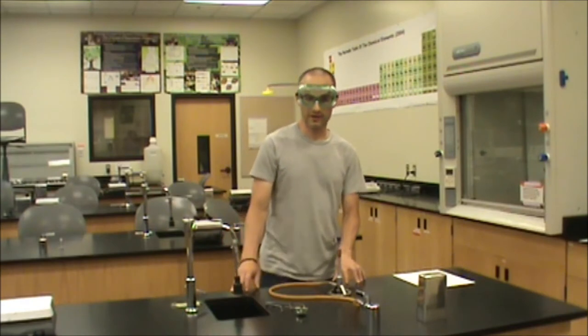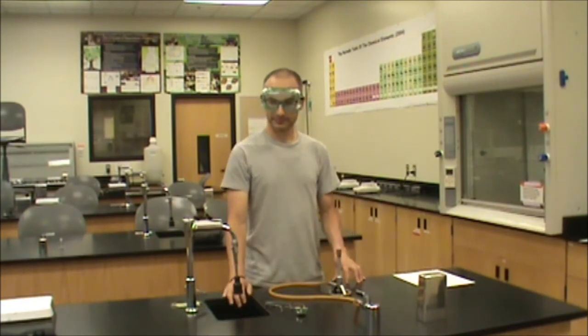One thing I'd like to talk about is the different parts of the flame. So let's dim the lights and zoom in so we can get a better view of this flame.